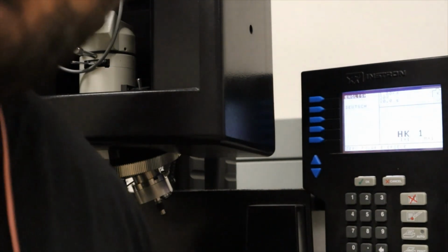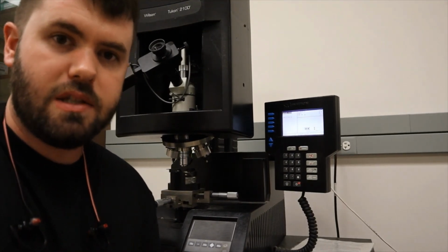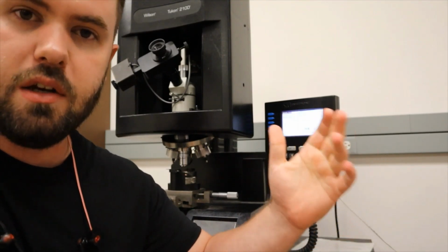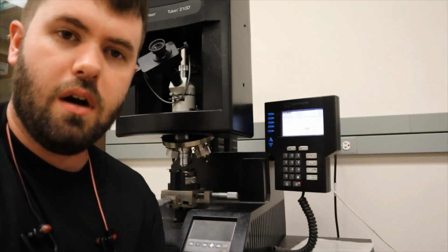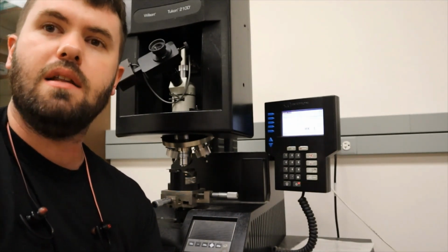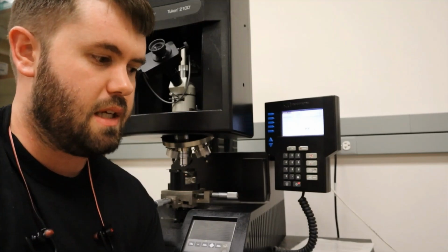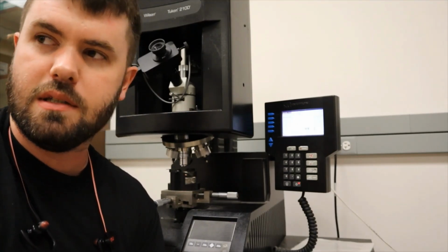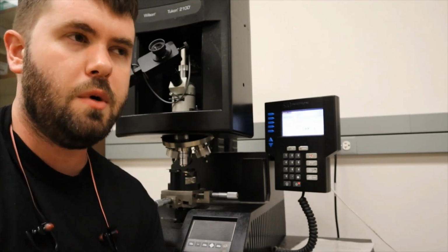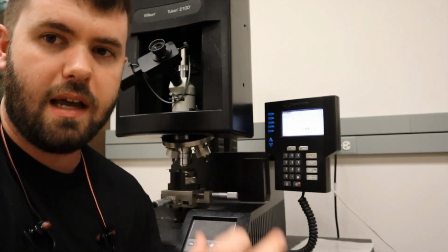It's going to ask us to zero the eyepiece. Unlike in the first lab, where we were measuring a and c, our crack lengths for our system, here we're just calculating Knoop hardness. So we can use this machine to directly measure the diagonal. In the material science handbook, in the same section where they talk about hardness tests, they tell you how to calculate a Knoop hardness. It's like 14.2 multiplied by P divided by the longest diagonal squared.